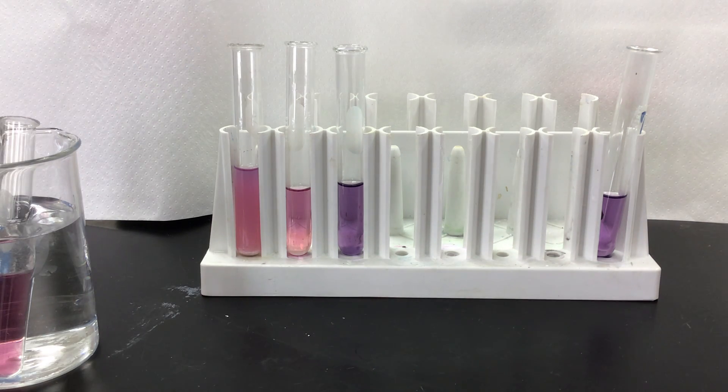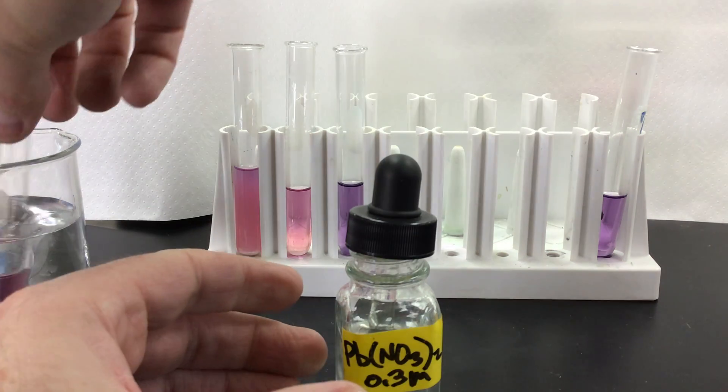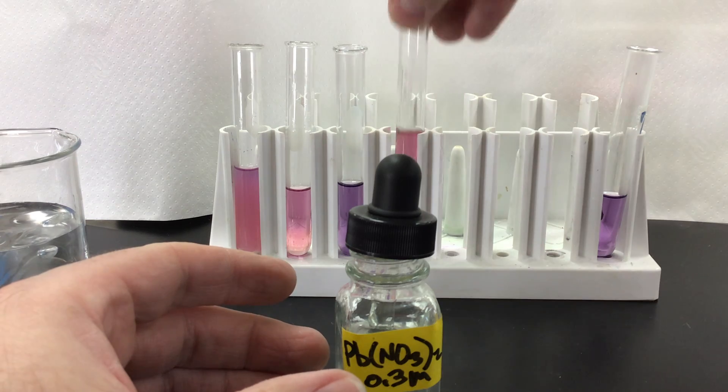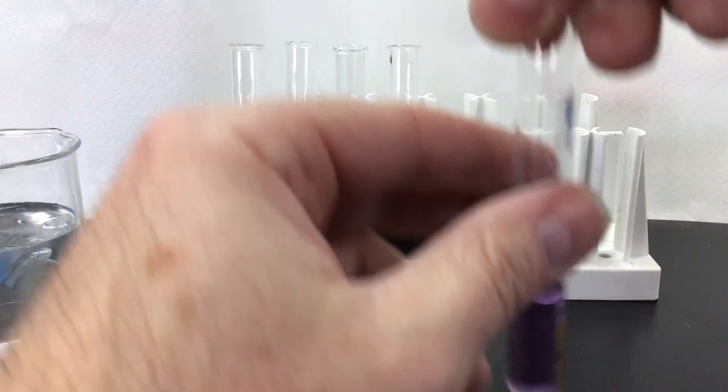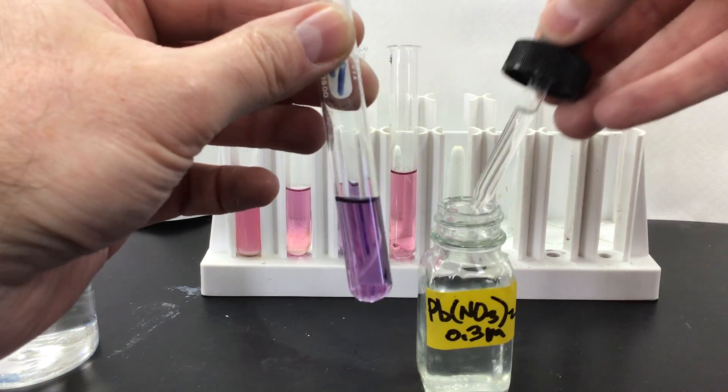We've got some lead nitrate as well that we're going to add to one of ours. I'm going to take one of these out, let that kind of get back to room temperature here for a moment. So I got my lead nitrate solution here. We're going to add a couple drops.